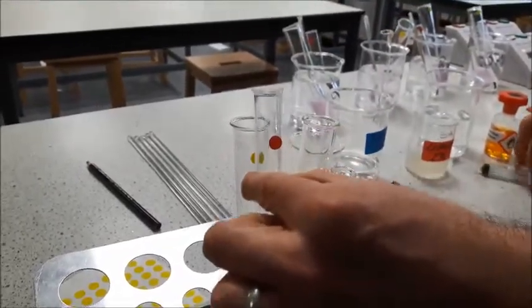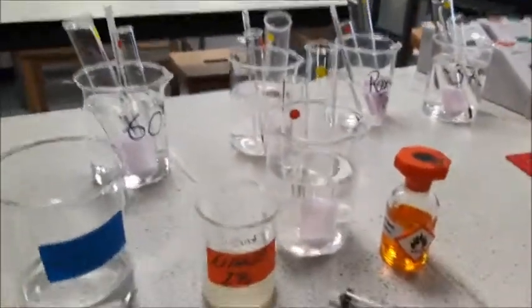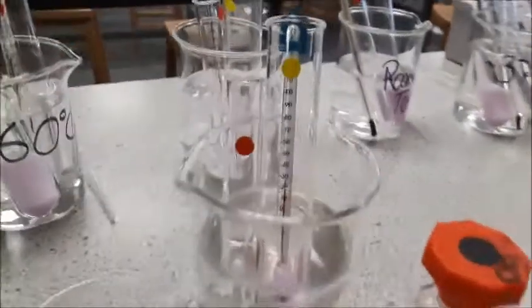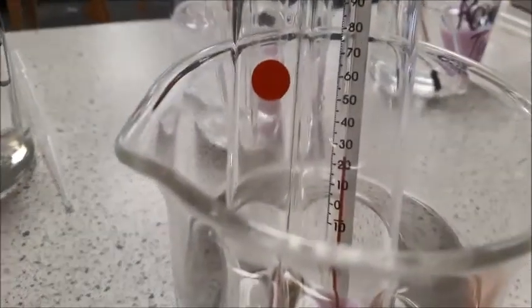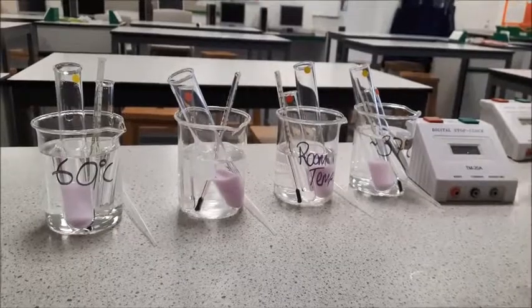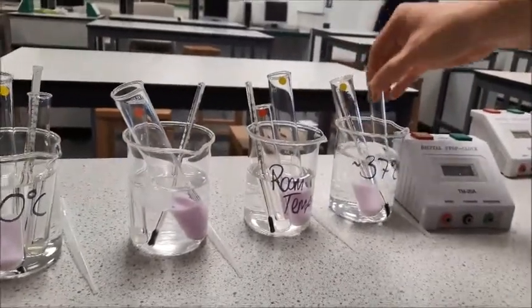Both of these are going to go into a water bath. We've got to let these temperatures acclimatise, so I'm going to put my thermometer in there with the milk. We've got to let both chemicals reach the correct temperature before we start the experiment. Now these ones have acclimatised — the temperature of our milk solution and of our lipase are the same.